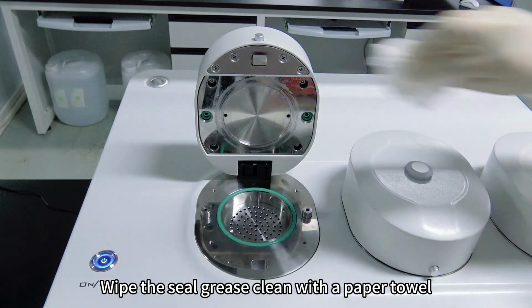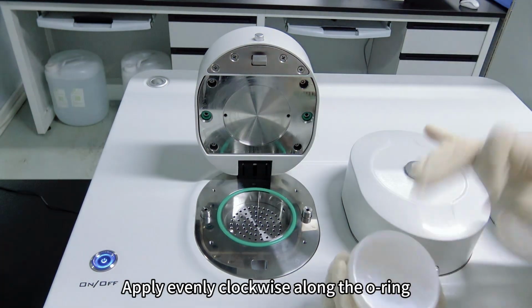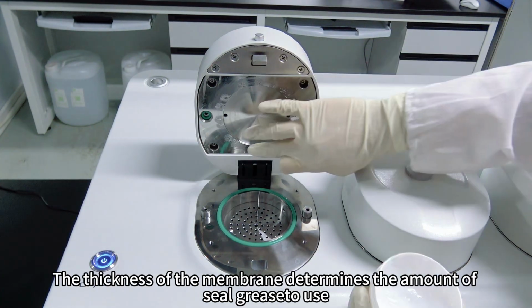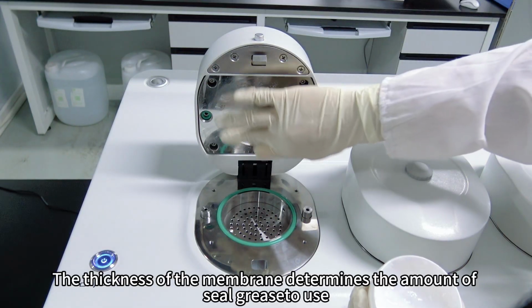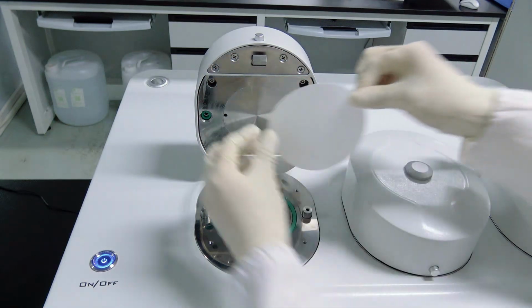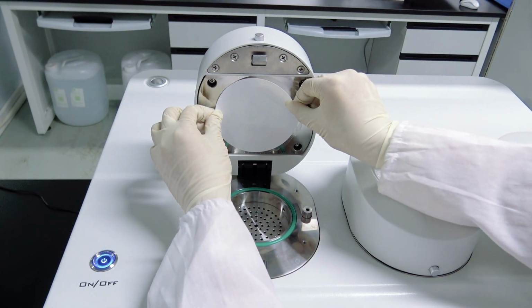Wipe the seal grease clean with a paper towel. Apply evenly clockwise along the O-ring. Just apply a thin layer. The thickness of the membrane determines the amount of seal grease used. Thick membranes need more seal grease. Test face up. The sample is gently aligned and placed on it.